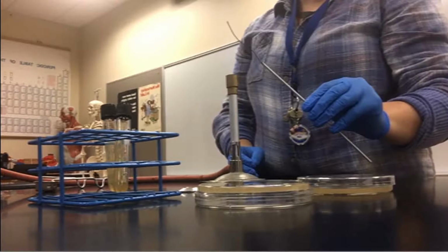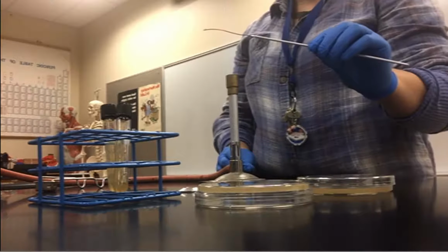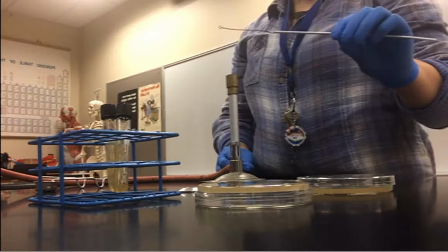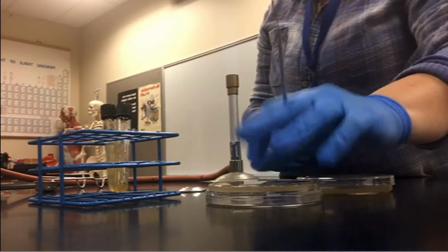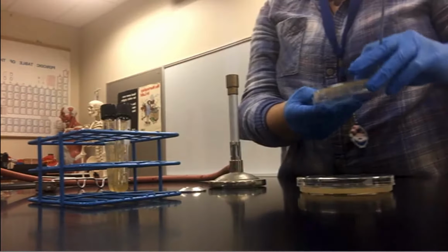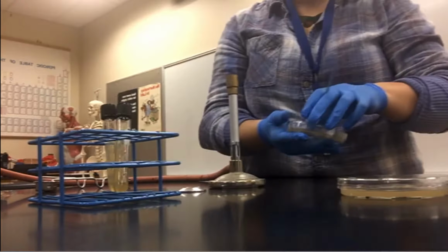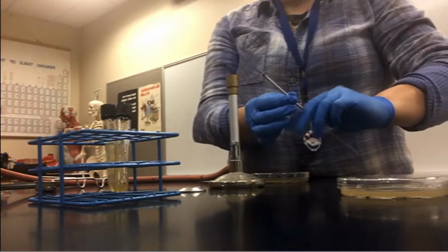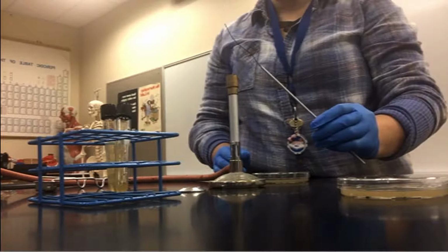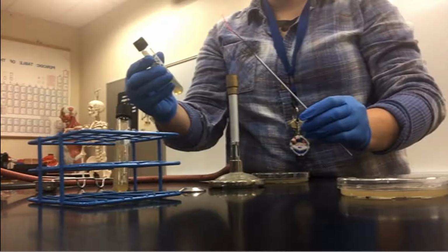So this is going to be a zigzag across the surface of the plate the way you're used to streaking. Just at the end, I'm going to do this last little touch where I dig the loop midway into the agar. So I don't want to touch the bottom of the plate, but I want to get it inside the layer of agar. I'm going to set up my PEA plate first. Actually, I'm going to leave that lid on until I'm ready to lay down the bacteria. I'm going to do E. coli just because it's first up.